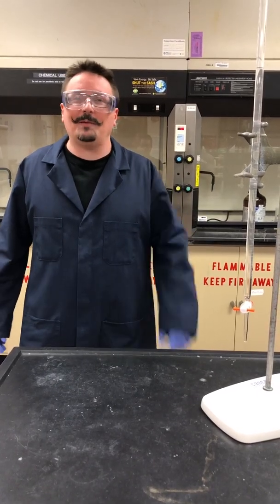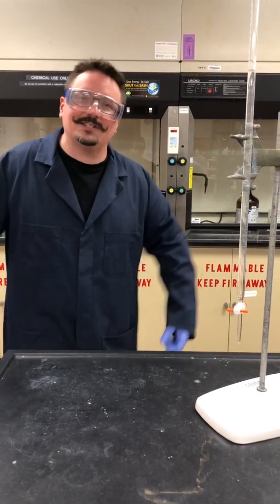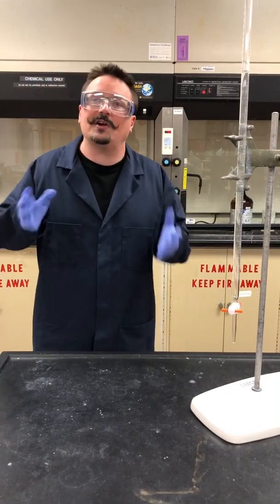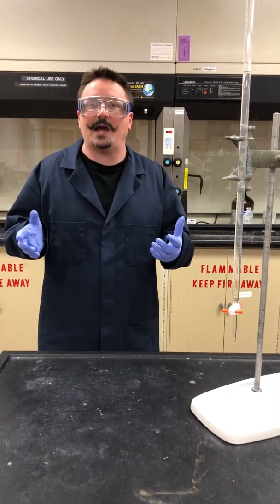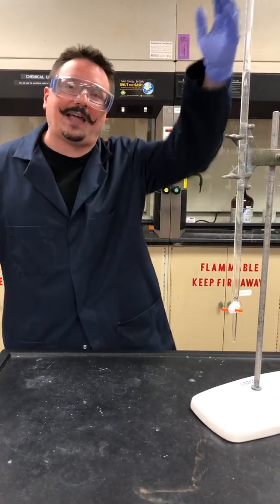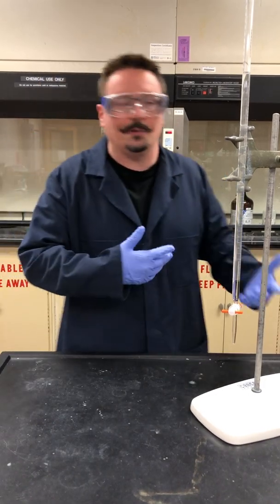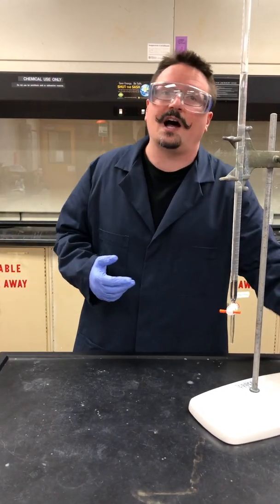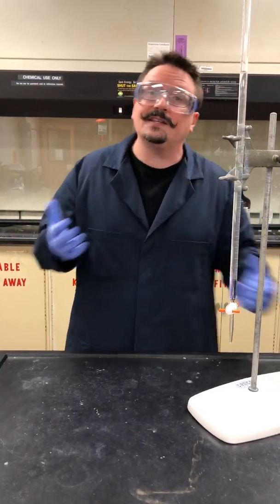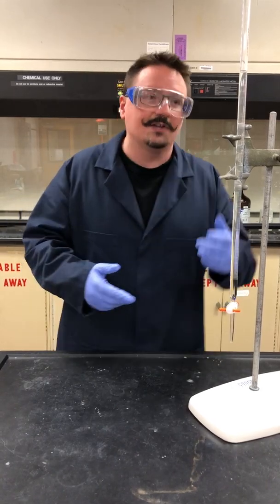Hey everybody! Today we're going to talk about titrations, and we're going to get to actually see one in action. Titration is a very specific reaction where we're allowed to measure out very small, specific aliquots of a substance and determine what the concentration of an unknown is. In this case we're going to look at titrations of acids and bases.